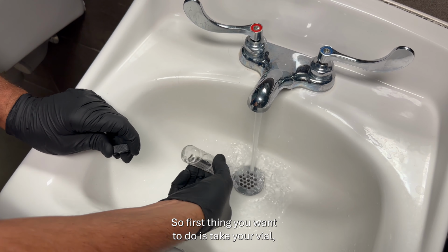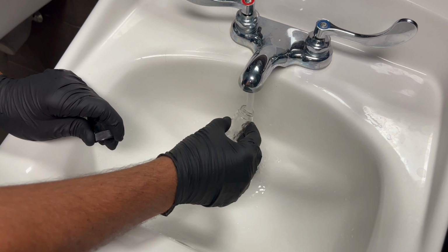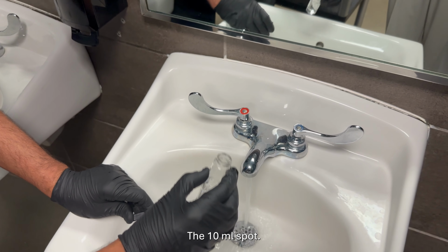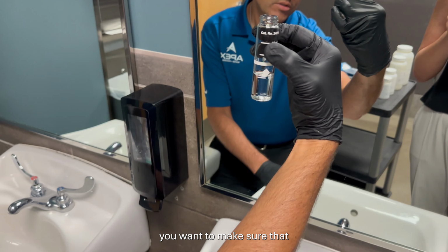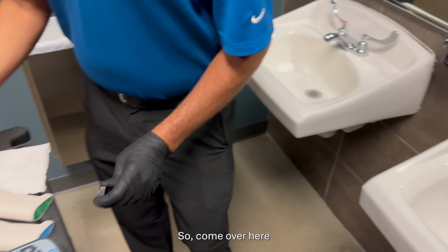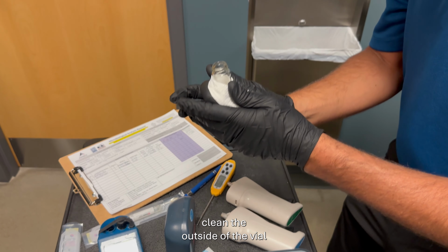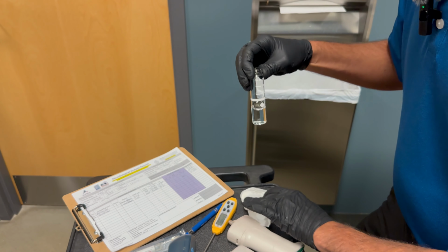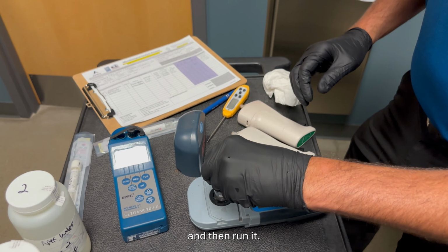So the first thing you want to do is take your vial. You want to rinse it out a few times. And then we're going to try to get to the spot that's on the vial, the 10 mil spot, where the meniscus is. You want to make sure that it's right about where it needs to be. It's pretty close. So come over here. Clean the outside of the vial, because that can disrupt the readings on our particular meter. Put the cap back on here and then run it.